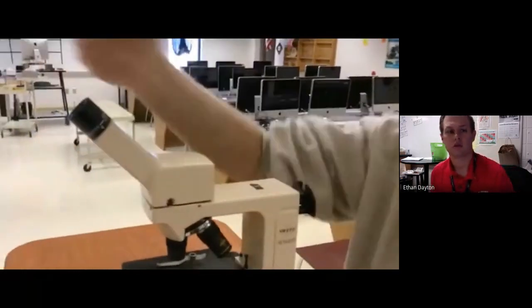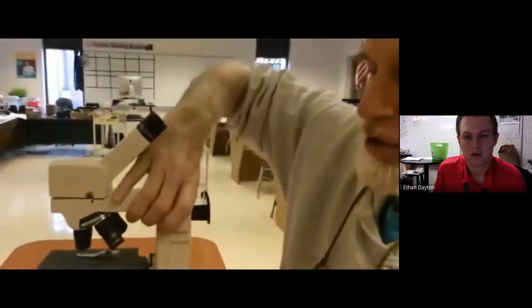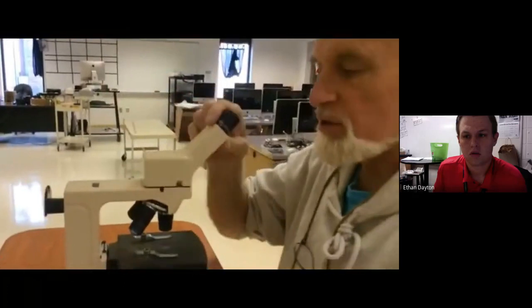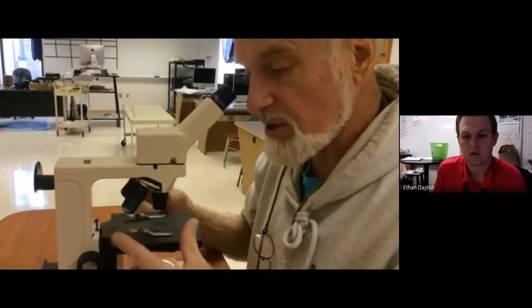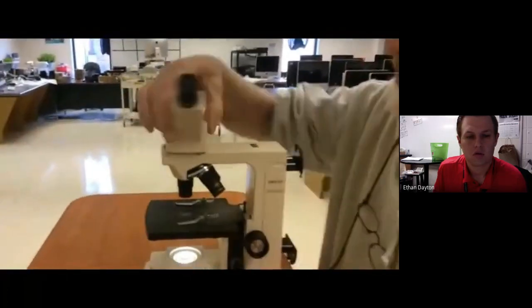This allows the teacher to be looking at it from this end and for you to be looking at it from this end. If you'd rather load your microscope differently, you can turn your microscope all the way around, turn the eyepiece to be working this way, and slide your microscope slide in this position instead. But most people work with the arm in the way and just work this way over the top.